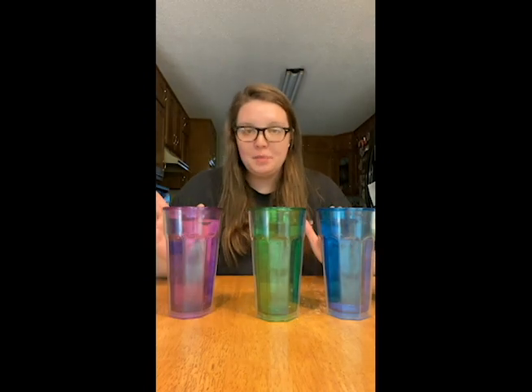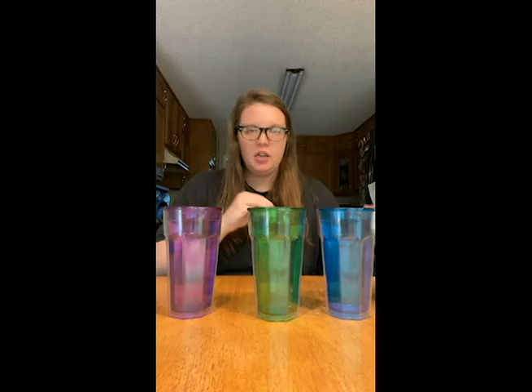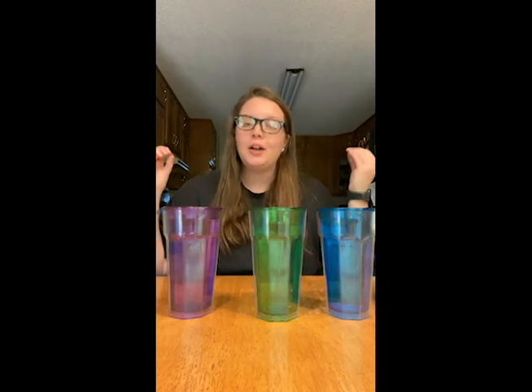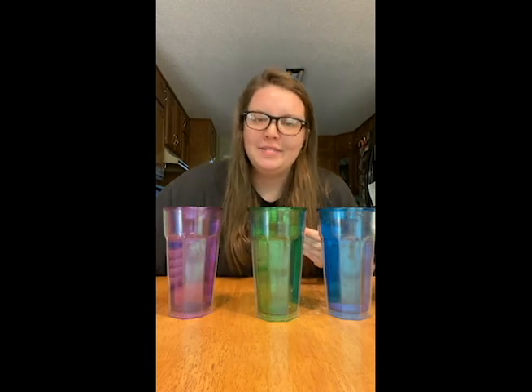So what that says to me is the warmer the temperature, the more soluble a substance becomes. So solubility and temperature are directly proportional to each other. I hope you enjoyed this experiment.